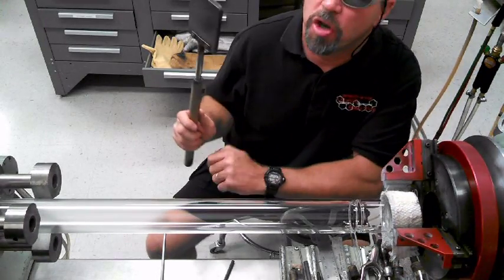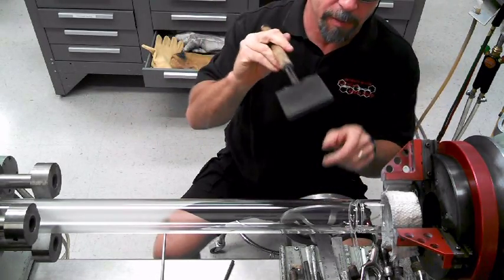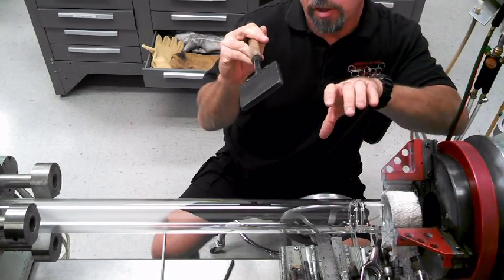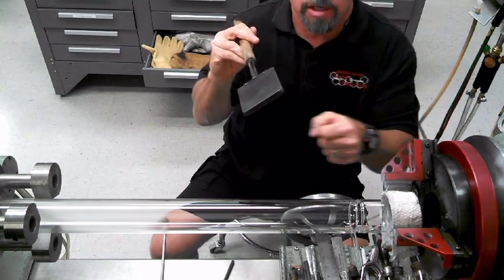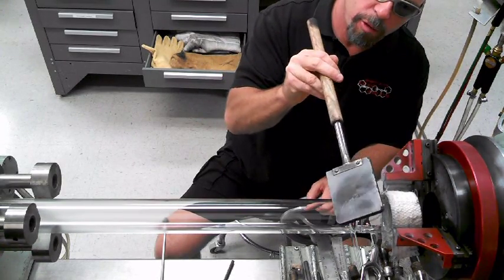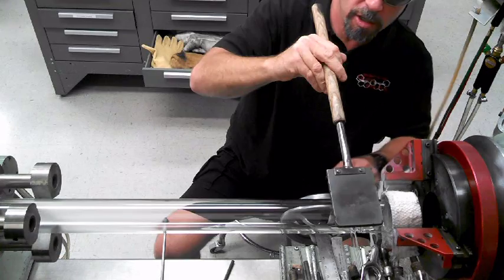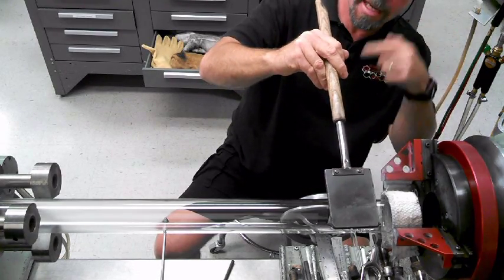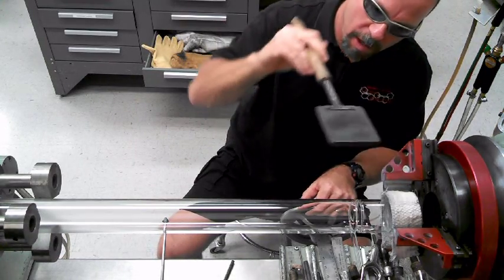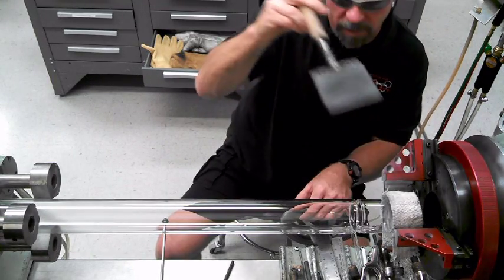So this is the gist of a no-blow seal — there's no corks, no blow on either side. What I'm going to do is stick these two together, turn the lathe up to a point where the glass is neutral but slowly starts coming out. I'm going to keep on working until I'm happy with it, then leave the lathe there and I'll paddle from the pulled glass, push the soft glass down and land on pulled glass on the other side. So when you're done you go like this, take your flame off and let it spin. A clean paddle — preferably you don't want to use a paddle but if you have to that's fine. That's why this one is really clean so it doesn't leave any marks.